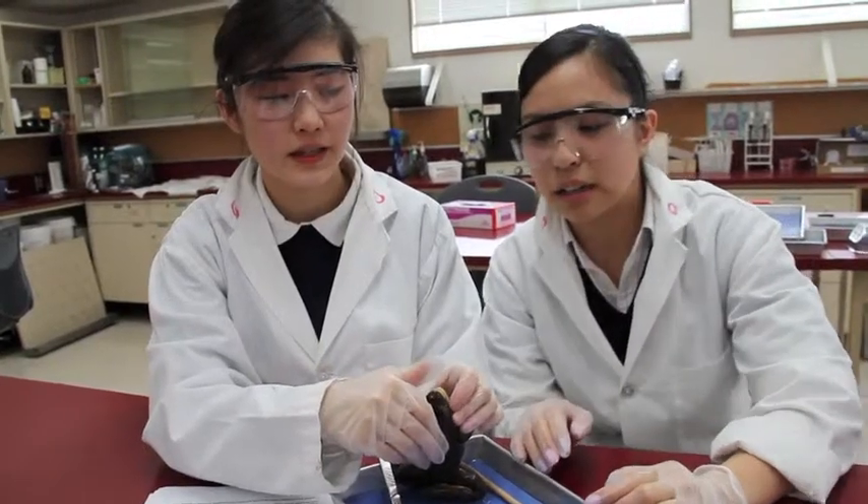We can take a look inside — anatomy. We've dissected fetal pigs before, so I guess we can compare it to that. In Bio 12 we dissected a lot, so this is just like remembering, reminiscent of last year.